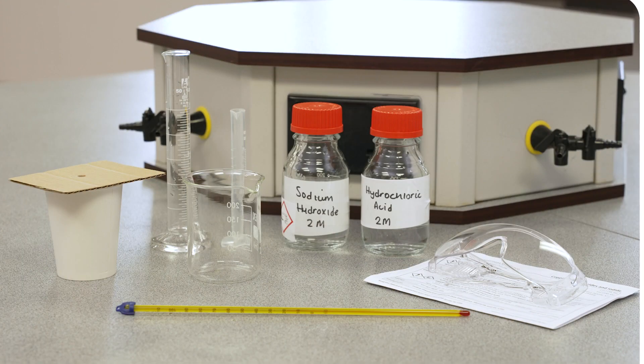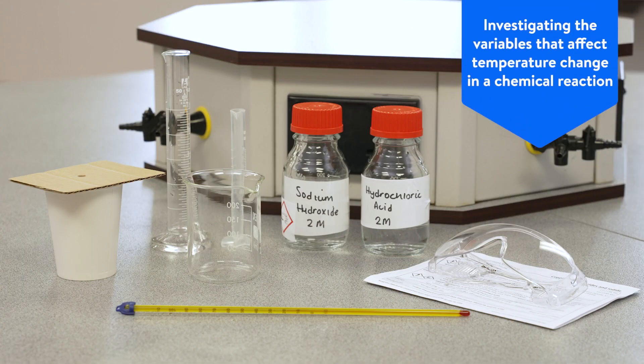Welcome to our video that will show you how to set up and carry out the GCSE required practical for temperature change to investigate the variables that affect temperature change in chemical reactions.